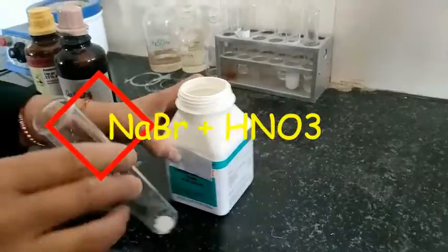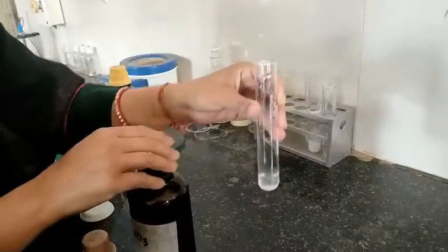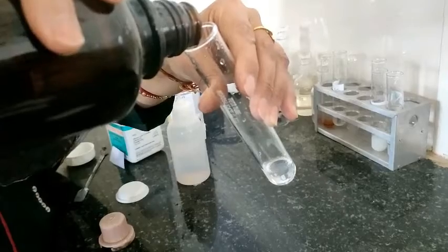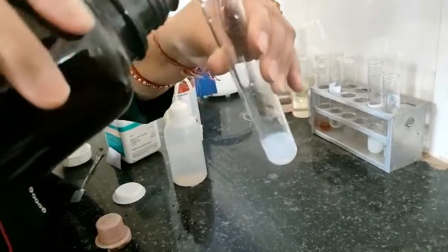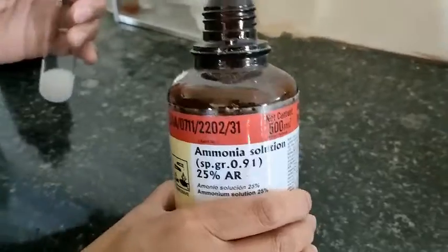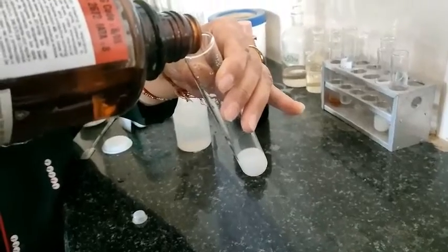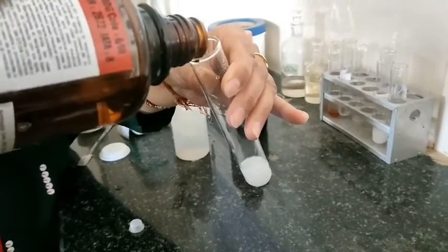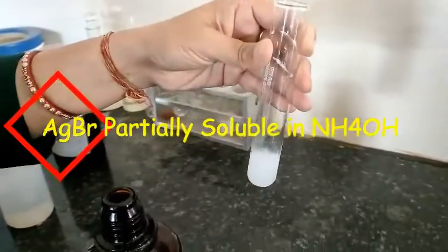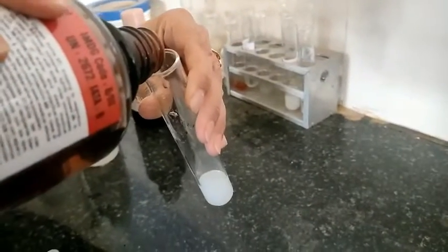Test for bromide ions. I have taken sodium bromide and to this I have added silver nitrate solution. You can see the precipitate of silver bromide. These precipitates are sparingly soluble in ammonium hydroxide, so ammonium hydroxide is added — and this shows it is only partially soluble.